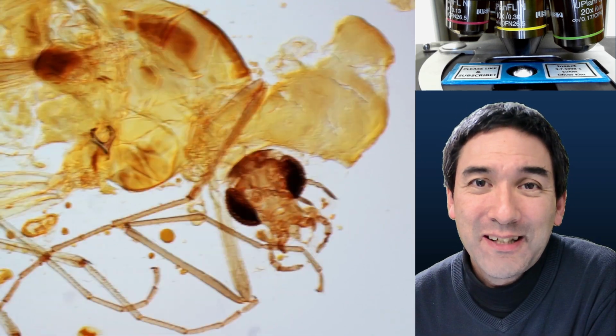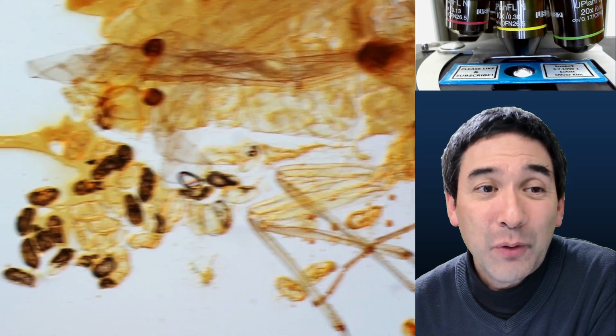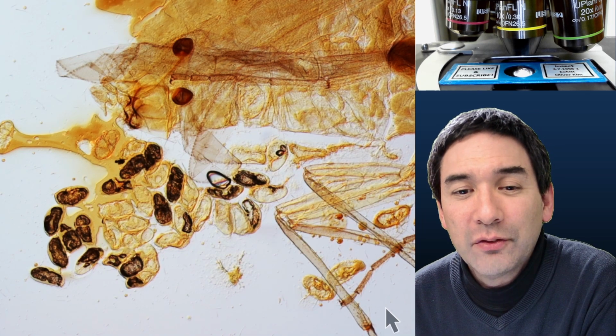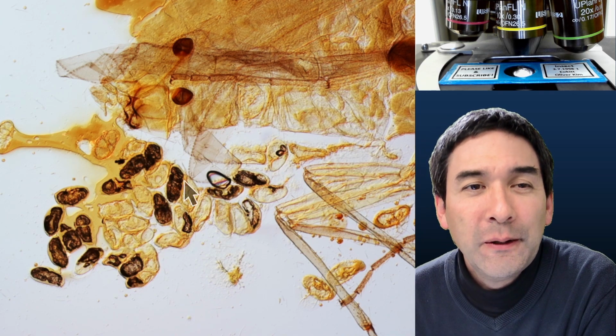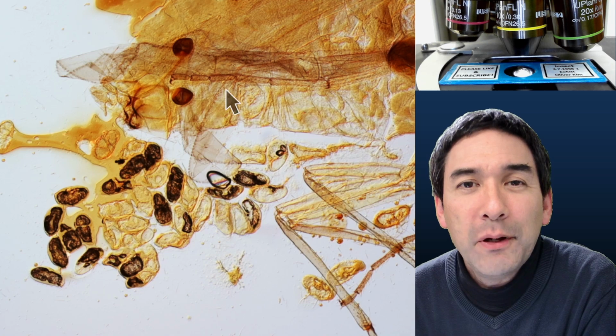So look at this here. Yeah, it's very crushed. The contents of the insect have spilled out. I can actually show this to you here. When I turn on the arrow, you can see all of those structures here. They almost look like eggs here that might have spilled out. The wing here is completely folded back onto itself. The second wing is up here, barely visible.